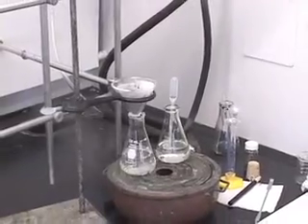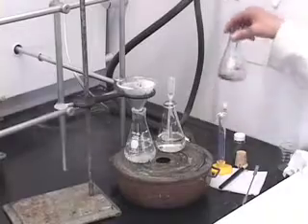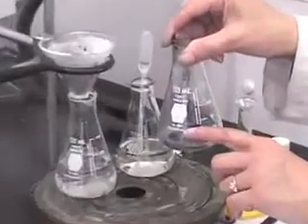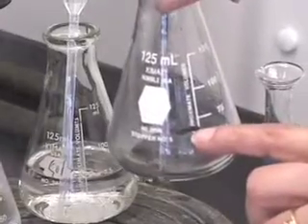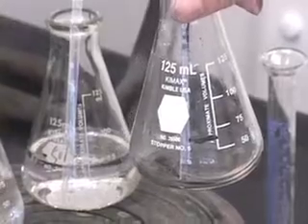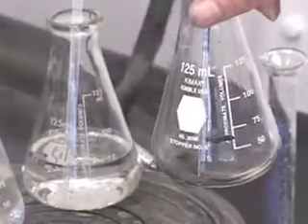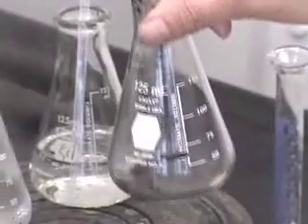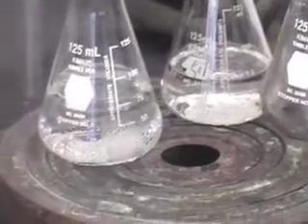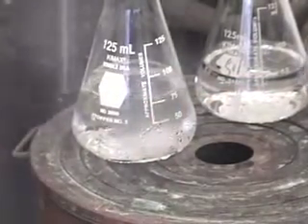And what do I have to do? Remember, we diluted this liquid. We had originally up to this level. I used the wax pencil to mark. And then I added extra solvent because I did not want premature crystallization of the product during hot filtration. So now that we have finished hot filtration, or we are about to finish hot filtration, you want to concentrate this solution to the same mark.